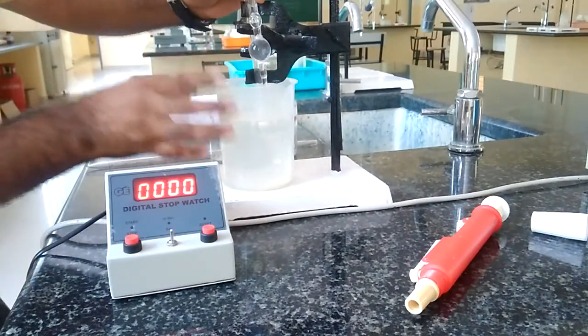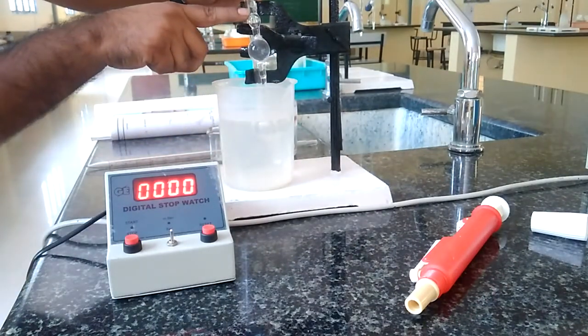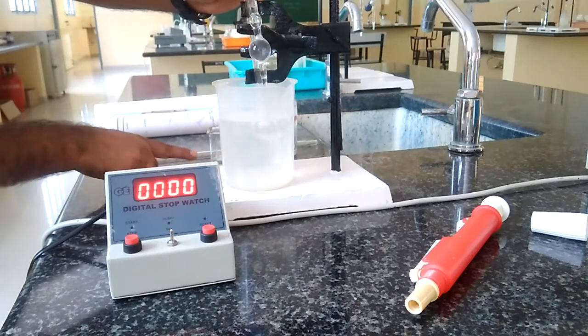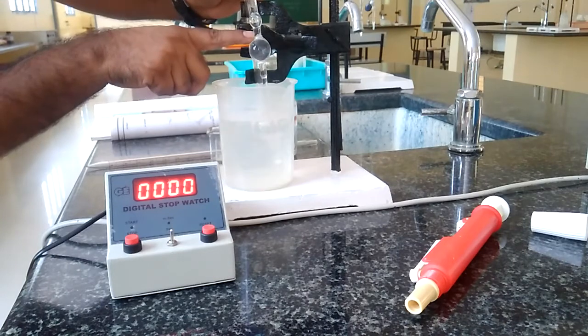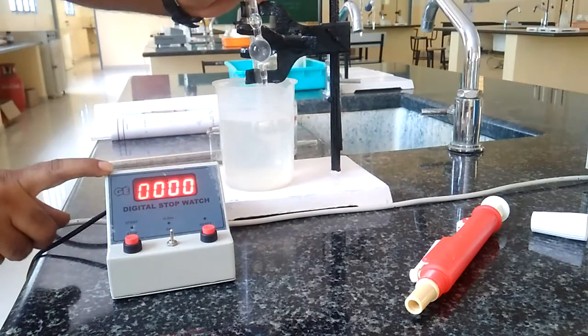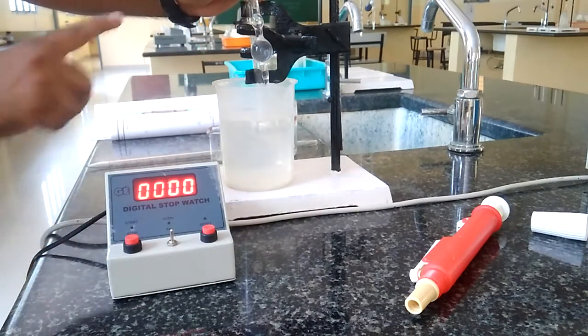Now let us leave it. Whenever the upper meniscus of this benzene or the organic liquid comes in contact with the upper mark, we have to start recording the time of flow of this liquid.